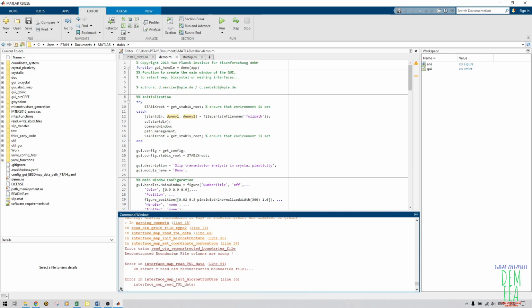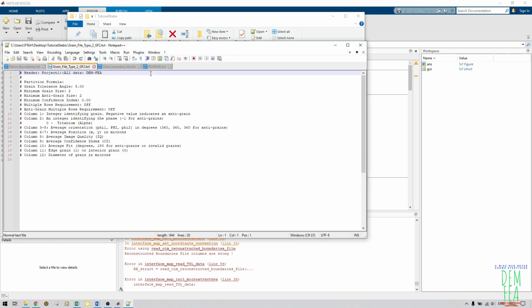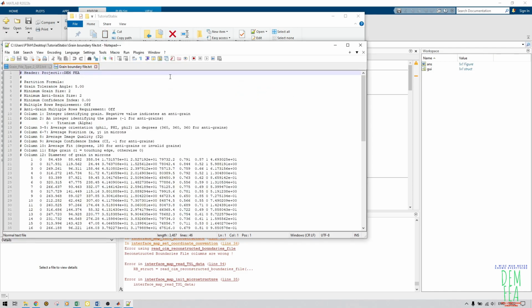So now we need to reorganize and check. From the tutorials that are given by Stabix, I managed to get these files, and I compared the reconstructed grain boundary files. So let's start with the easiest. The easiest is the grain file type, how to deal with it. Then we open the grain boundary file. As you can see here, this is my data.